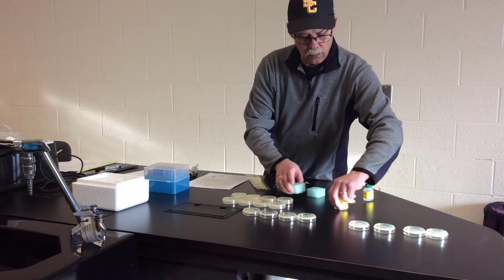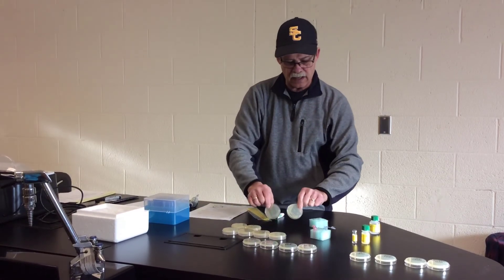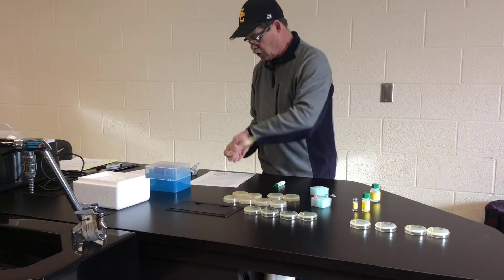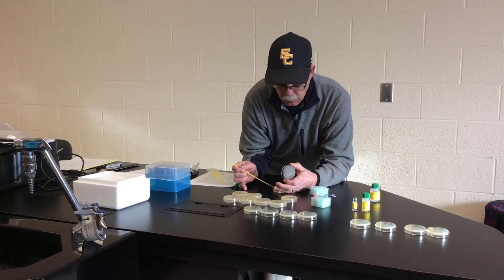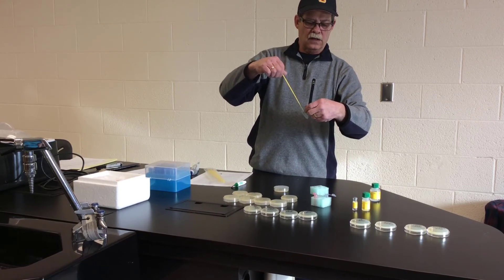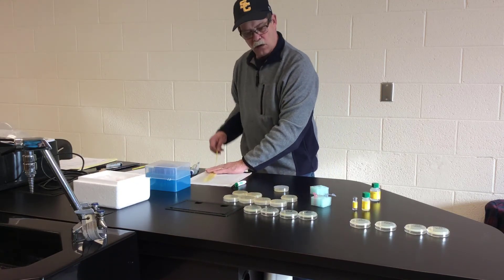We have what we refer to as starter plates — E. coli plates — streaked for isolation so that we have isolated colonies we can pick up with a sterile loop. We're going to pick up a single colony of bacteria and put it into the pGLO positive tube. I'm turning the plate over to grab a colony, then going into the pGLO positive tube, turning it back and forth to get the bacteria off into that transformation solution.